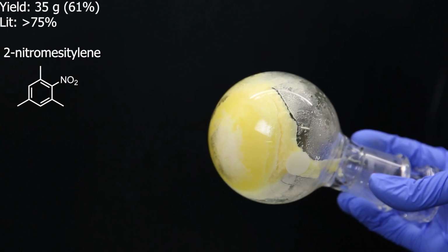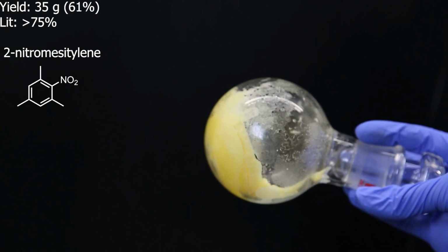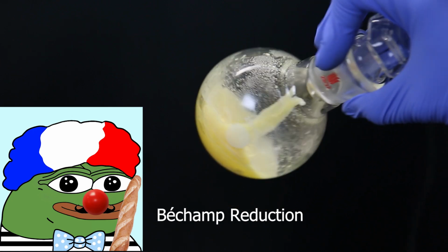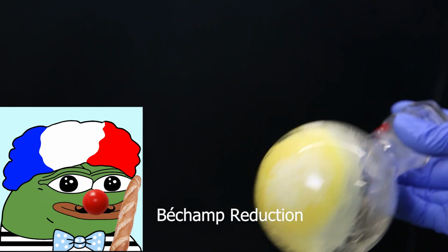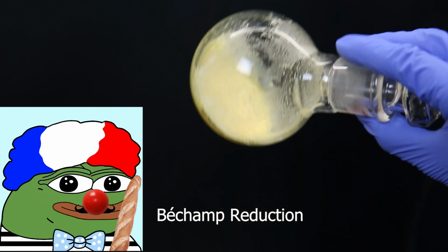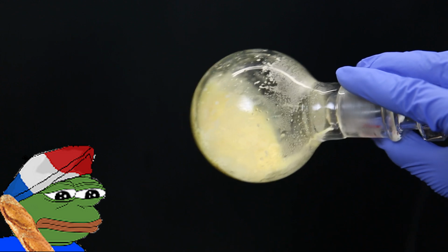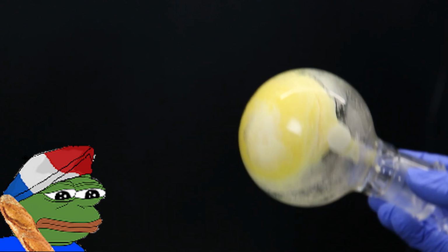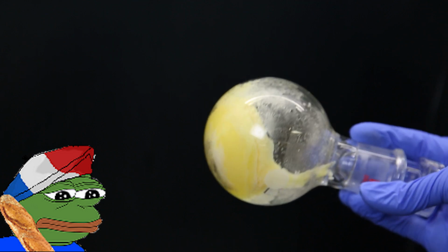Anyhow, with this decent yield, I can properly continue with the next step, which is the reduction of the nitro group to an amine. A simple method to do this is with a Béchamp reduction, which works well to reduce aromatic nitro compounds, and once was the prime method for the reduction of aromatic nitro compounds, but has fallen out of interest because hydrogenation is now the prime method for reducing them. I also tested the reduction with tin(II) chloride and hydrochloric acid, but it was less successful.